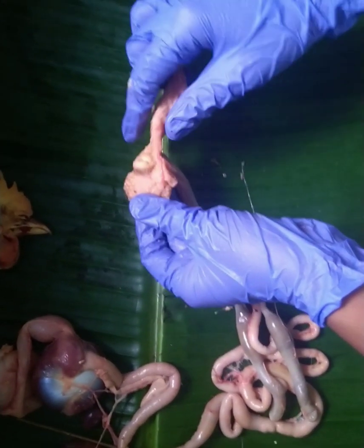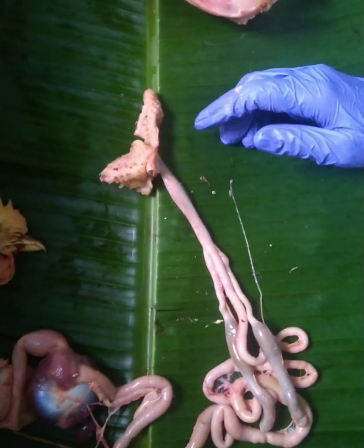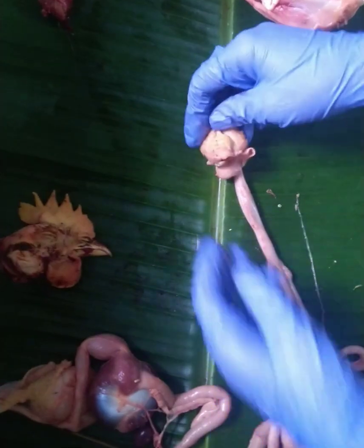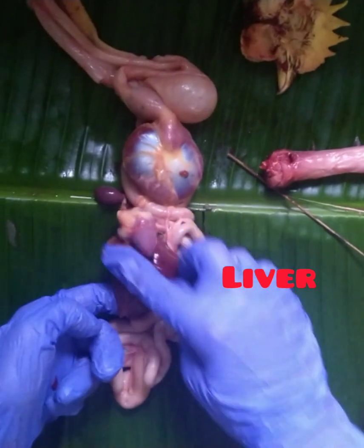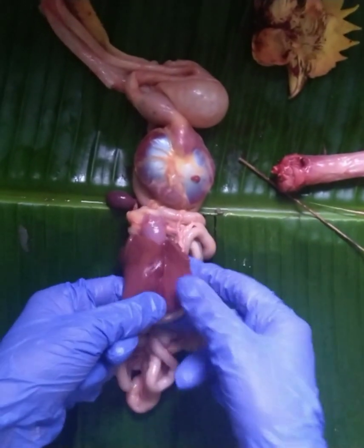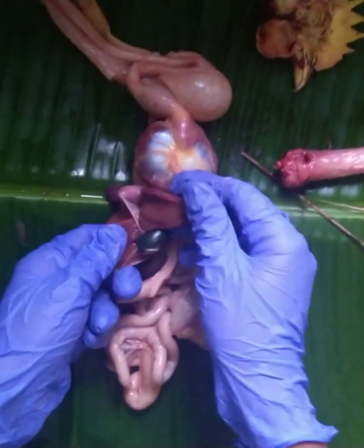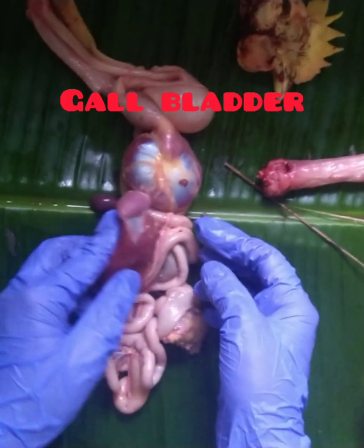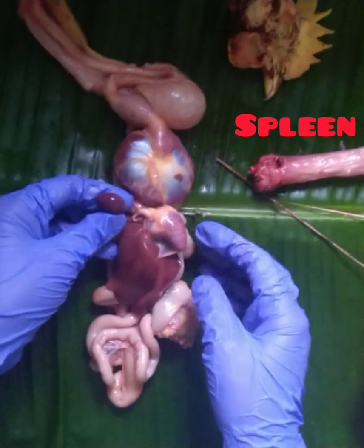The cloaca has a common opening to three systems: the reproductive system, the urinary system, and the digestive system. What we see here is the heart, and here is the liver. In the case of chicken, the liver has two lobes, as we can clearly see, and beneath it we can find a green sac which is the gallbladder. Beside it we can see a round structure known as the spleen.